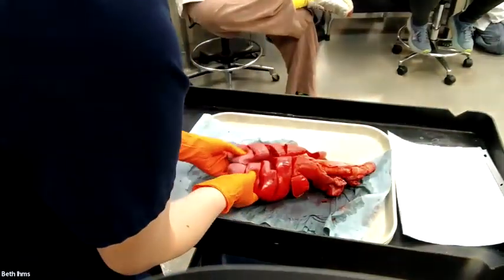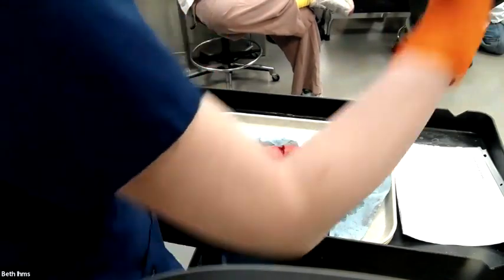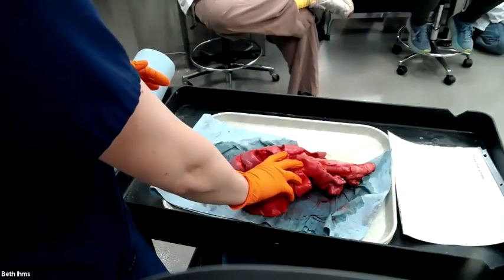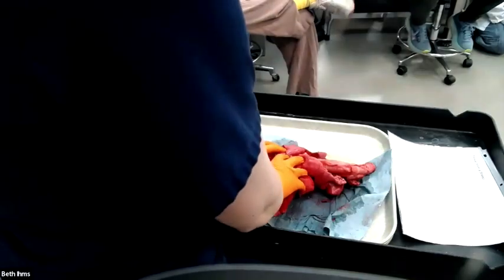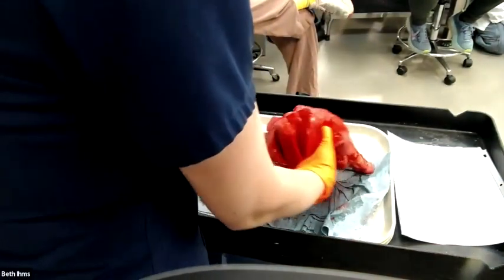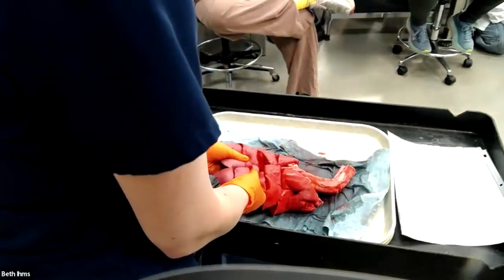This animal, I believe, was septicemic. So sepsis causes inflammation in the blood and in the whole body. So the site of infection was actually distant from the lungs, but the effects of systemic inflammation on the body have now affected the lungs separately from the bacterial infection that has gone on. Anybody have any questions about this specimen or this case?